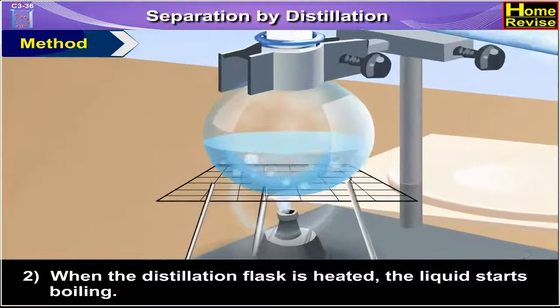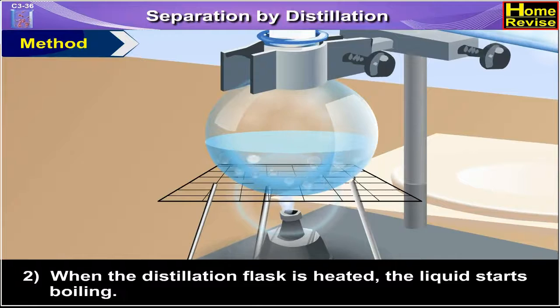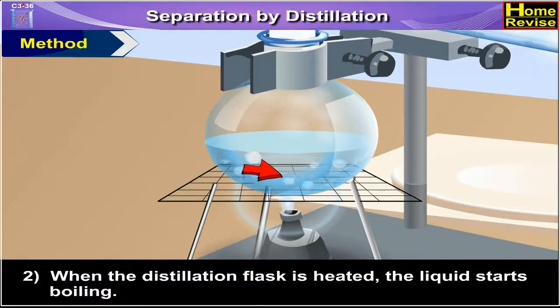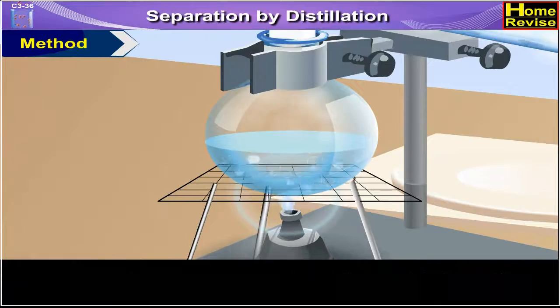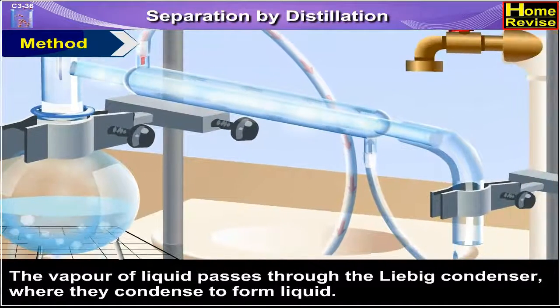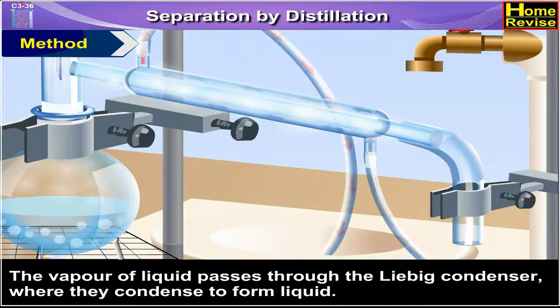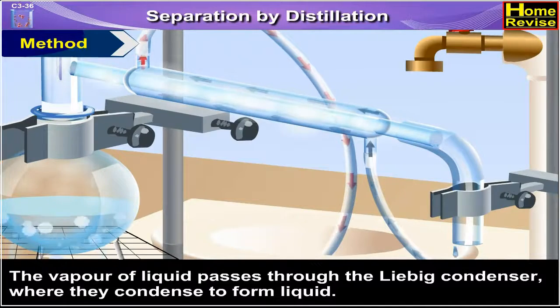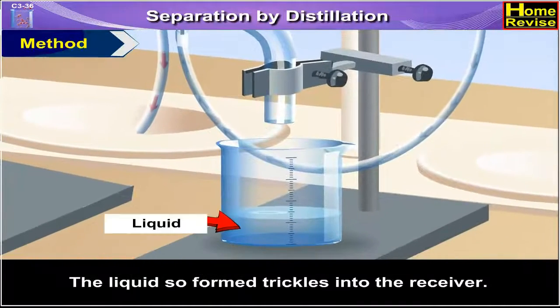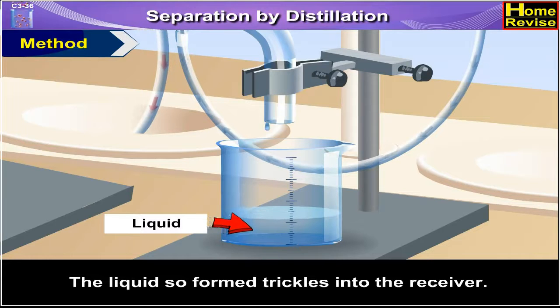When the distillation flask is heated, the liquid starts boiling. The vapour of the liquid passes through the Liebig's condenser, where it condenses to form liquid. The liquid so formed trickles into the receiver.